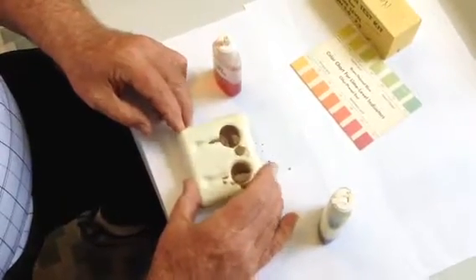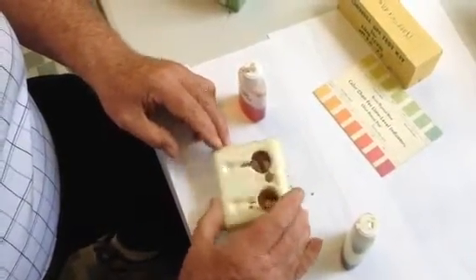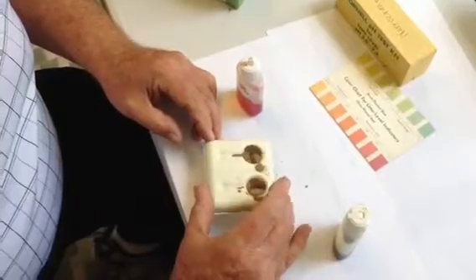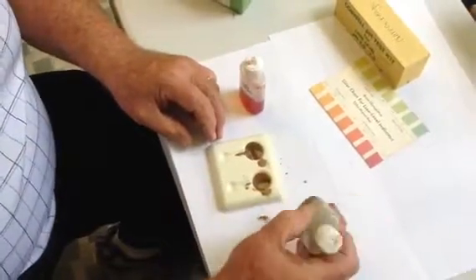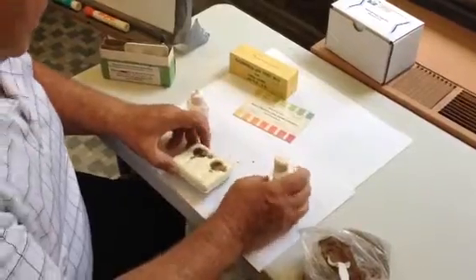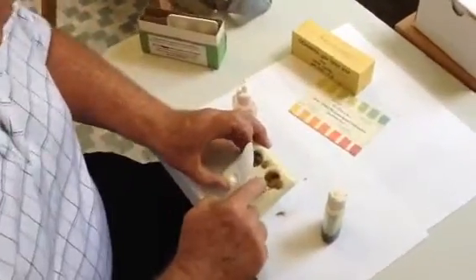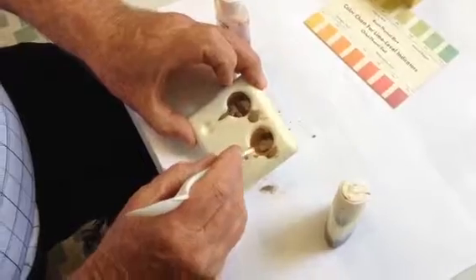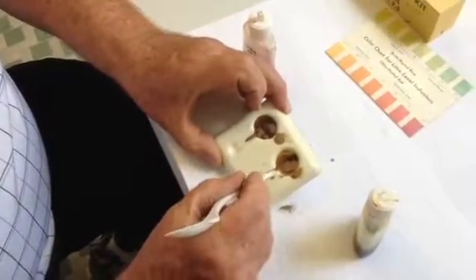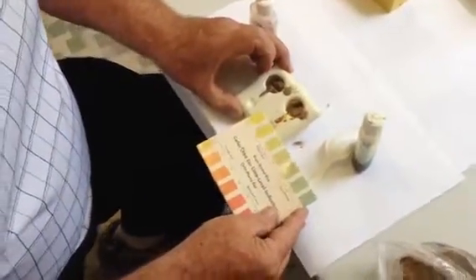So what I like to do is just rock it gently and give the soil a chance to react to the chemical reagents. Now, in the vial where we used the Bromothymol Blue — which is the higher range — you can see that already around the edge, if you tease a little liquid out, it's gone from dark green to almost yellow, which means this is basically off the scale. So it's way, way low.